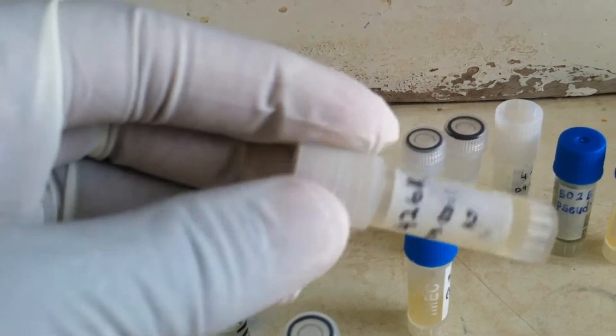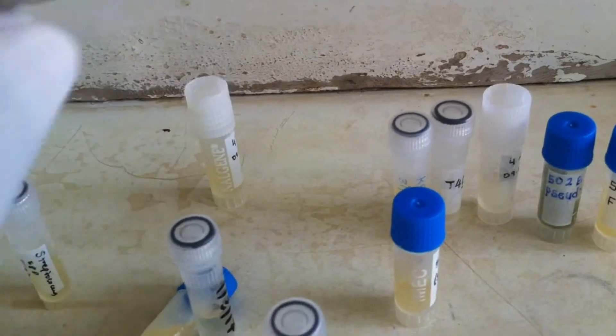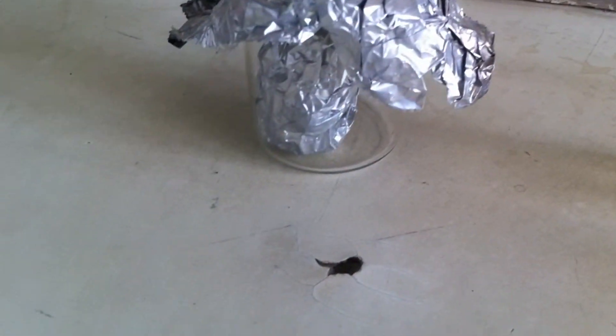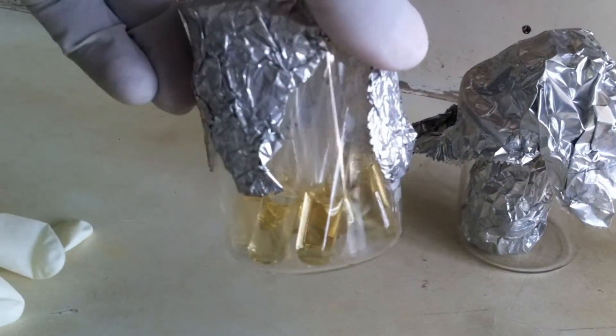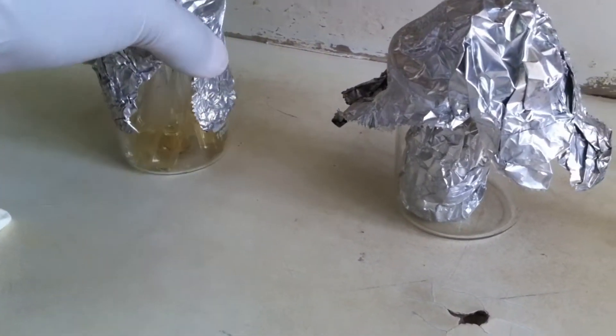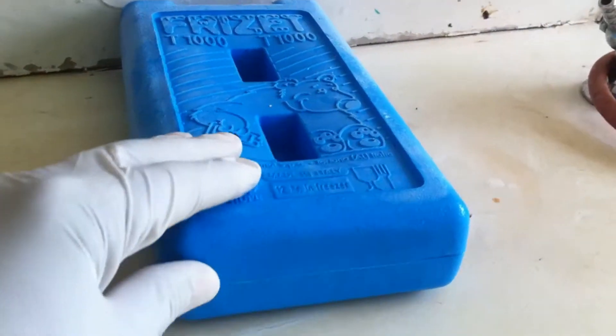All of the isolates were quite tidy. Now we come to this side, we see our TSB broth we are going to use as our media for resuscitating, and this side we have our cold block.